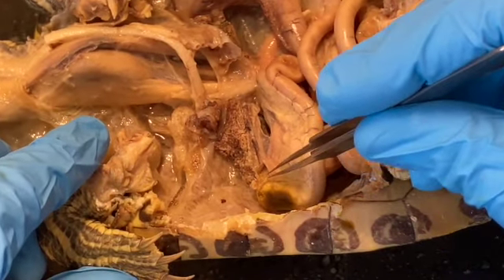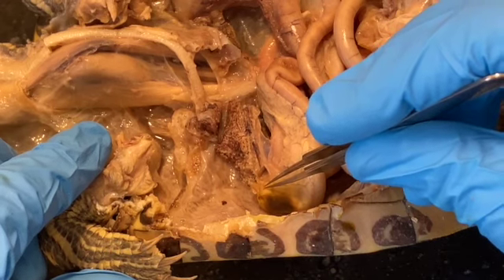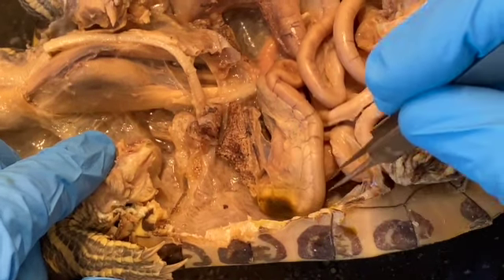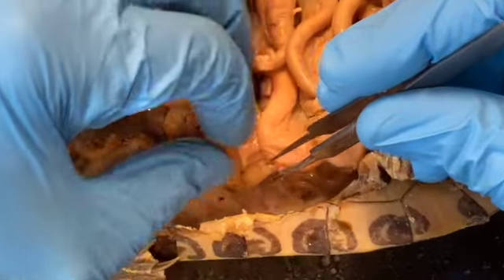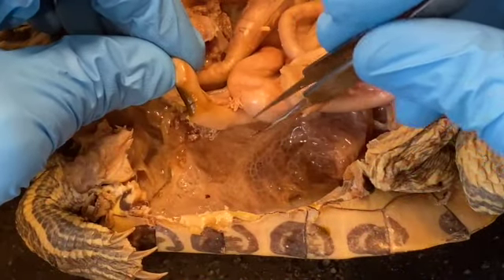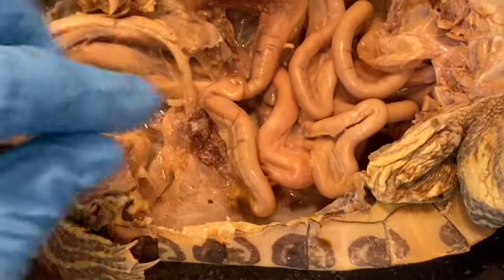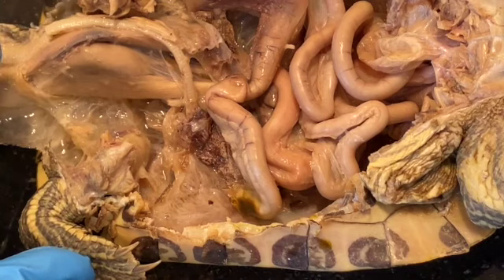This spot right here is where the bile duct was connected. This marks the upper end of the small intestine. So really from about this point on is going to be small intestine, winding its way all the way down toward the posterior end of the digestive tract.